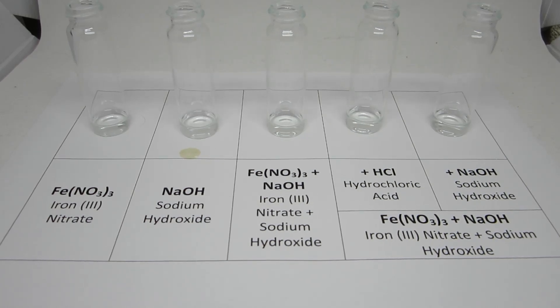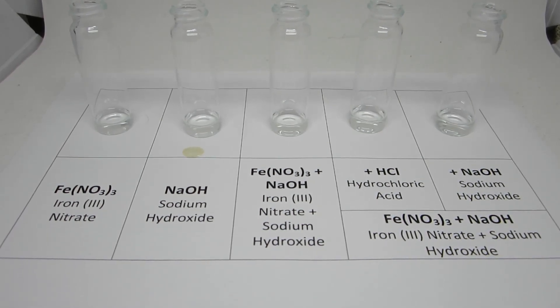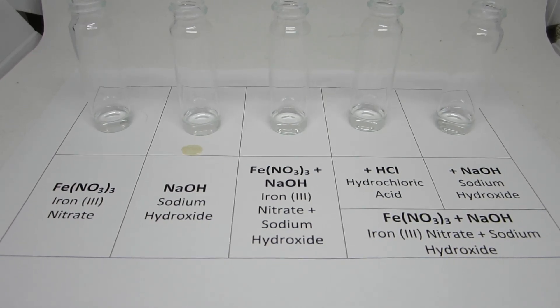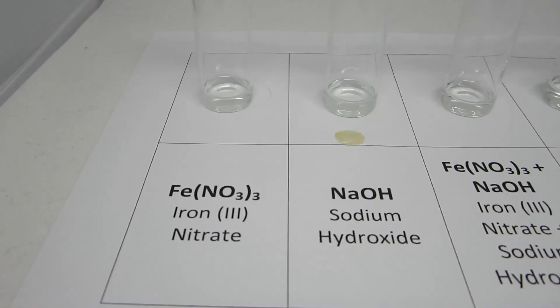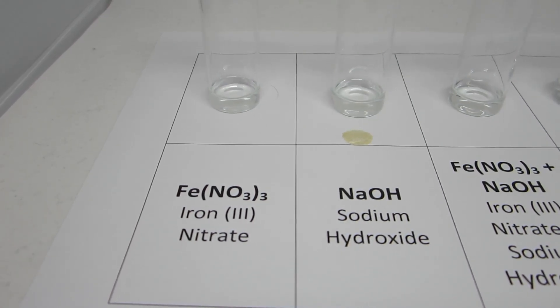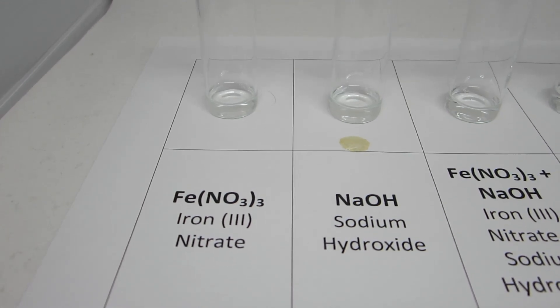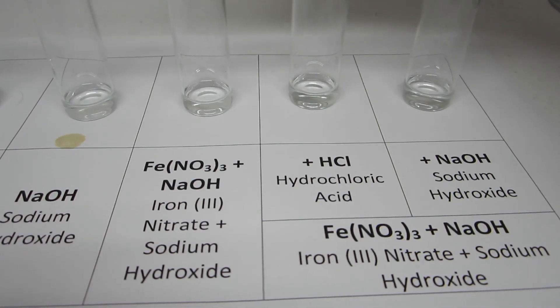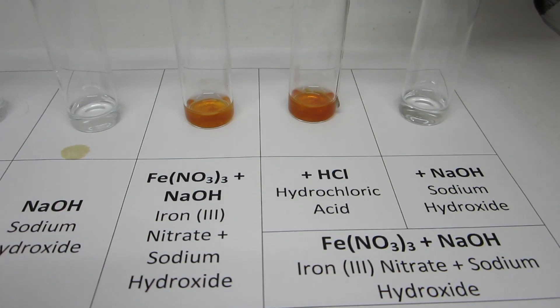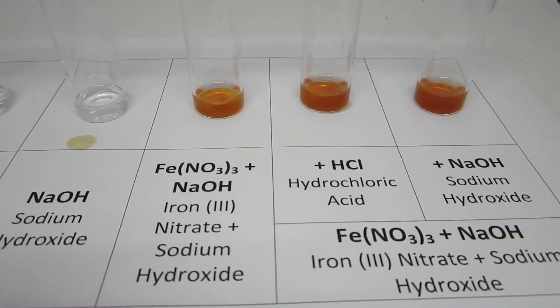The fourth reaction looks at the equilibrium between iron(III) ions and hydroxide ions. This reaction occurs in two steps, as there is both a precipitation reaction and a reaction which dissolves the precipitate. Initially, both the iron nitrate solution and sodium hydroxide solution appear clear and colorless, though at higher concentration the iron nitrate could appear as a pale orange. Upon addition of sodium hydroxide to the iron nitrate solution, a dark brown or orange precipitate of iron(III) hydroxide appears.